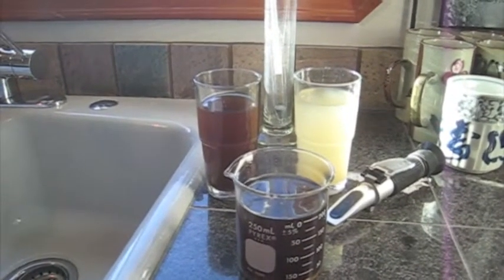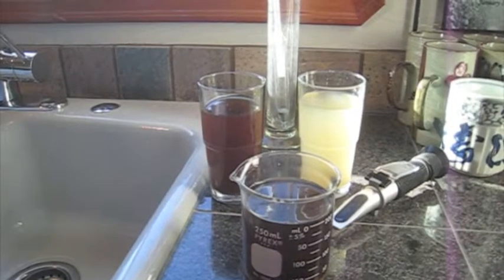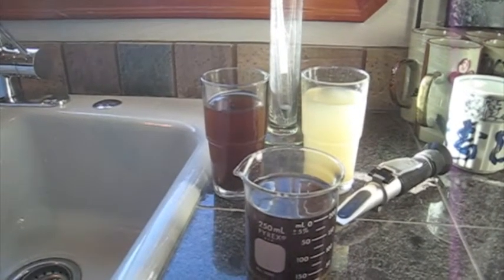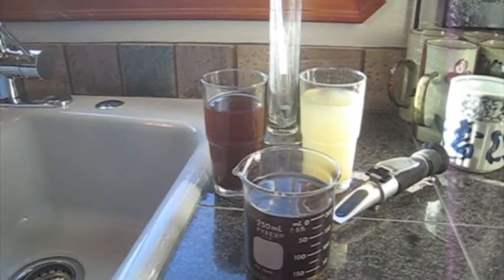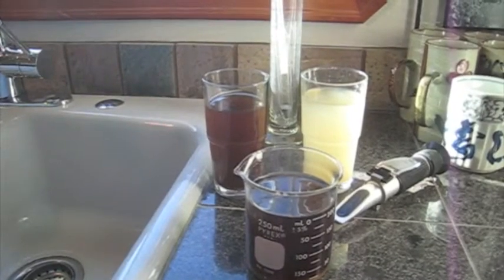They've all cooled to room temperature here. I'm going to go ahead and put them in the hydrometer. I'll log the numbers and then share that with you. So stand tight.